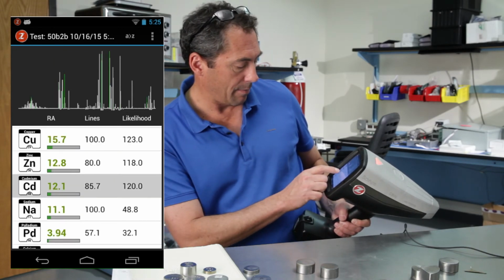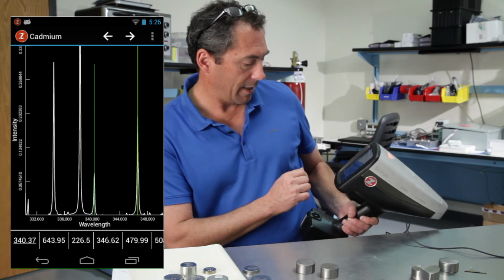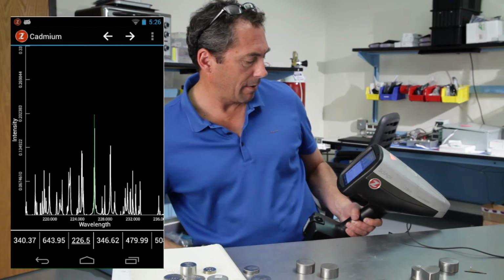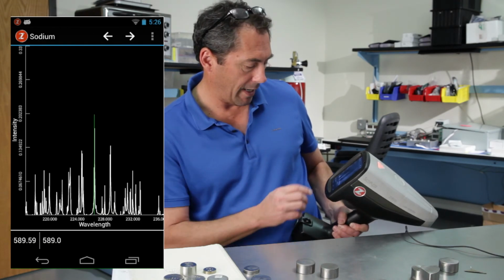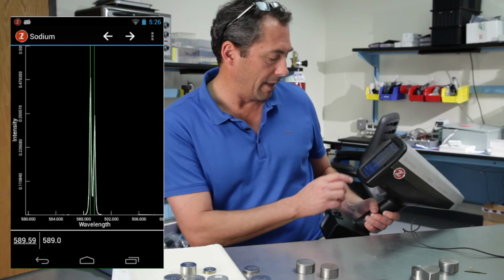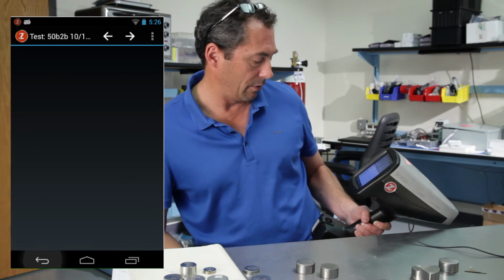Let's look at something more interesting. Let's double tap cadmium and tap there, and sure enough, you see two of the main cadmium lines. There's another one out at 640. Yet another one. So clearly there's a goodly amount of cadmium there. Sodium, again, is just from the handling, but typically you'll see your very characteristic signature of the twin sodium lines out in the high 500s. Again, the wide range spectrometer here allows you to capture that. Most other handheld LIBS don't.